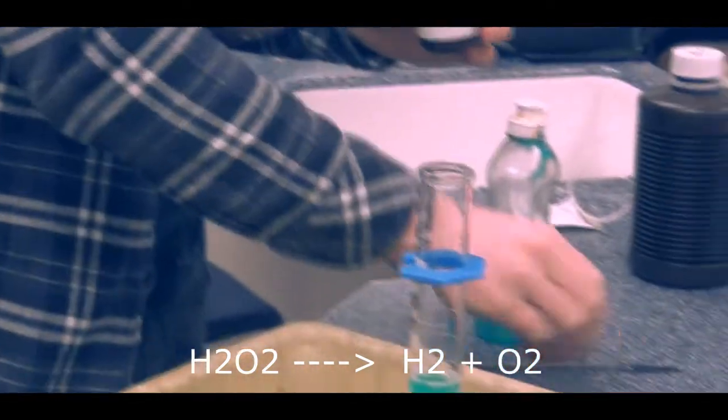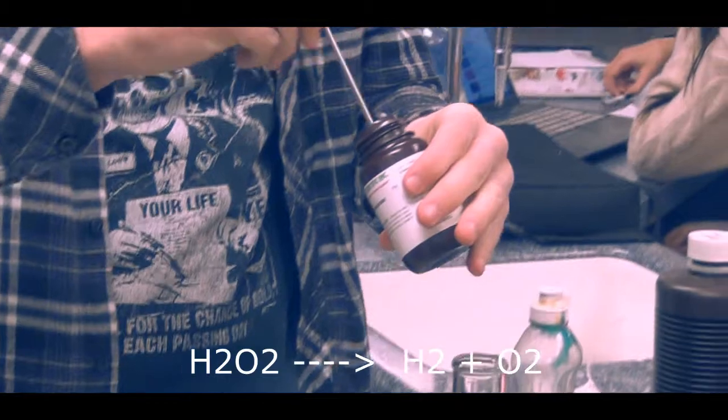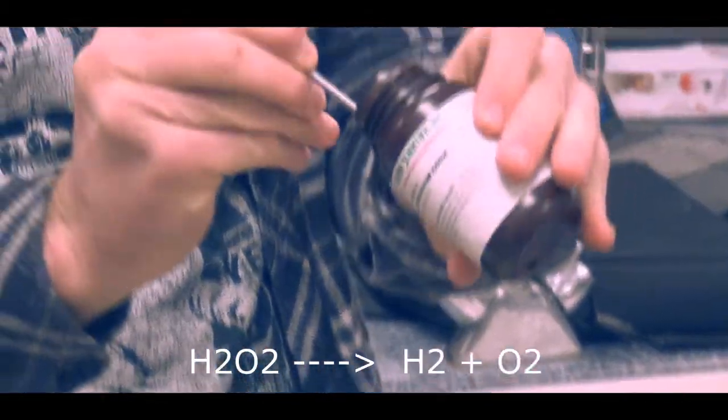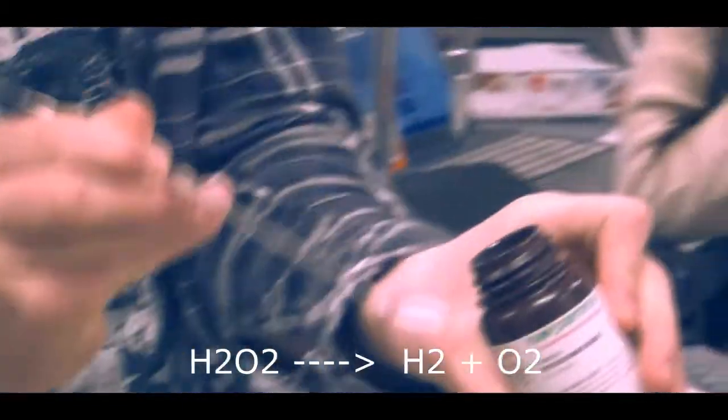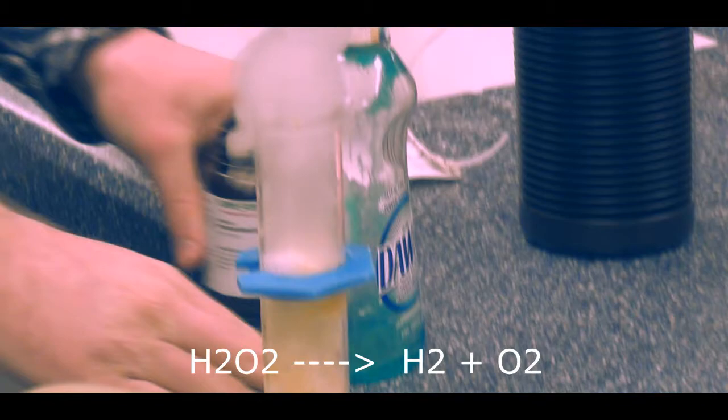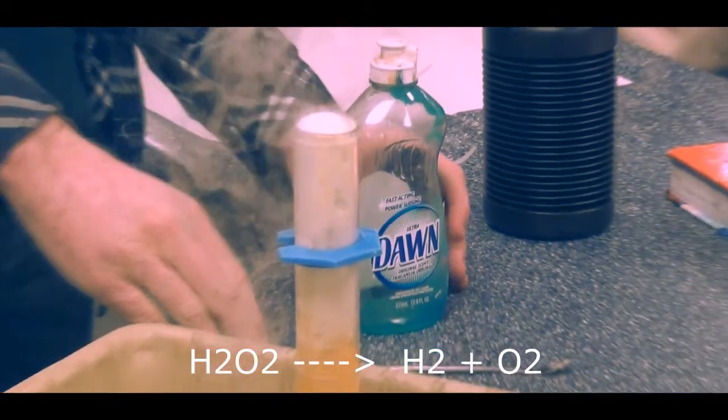However, in this demonstration, dish soap is added, which allows the gas to form bubbles, and potassium iodide is added as a catalyst, meaning it dramatically increases the rate at which the reaction occurs without altering the nature of the reaction itself.